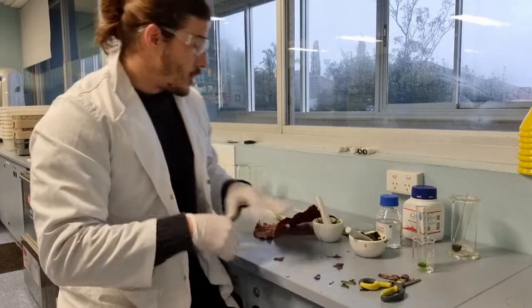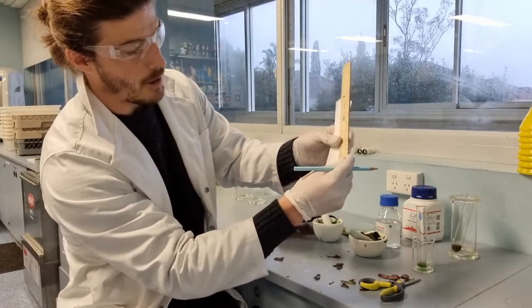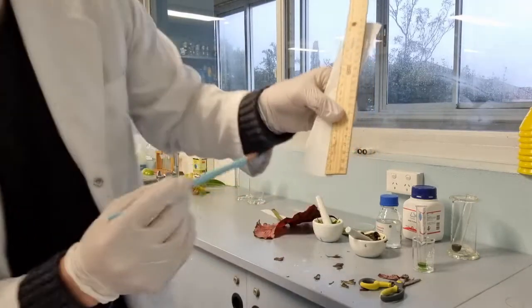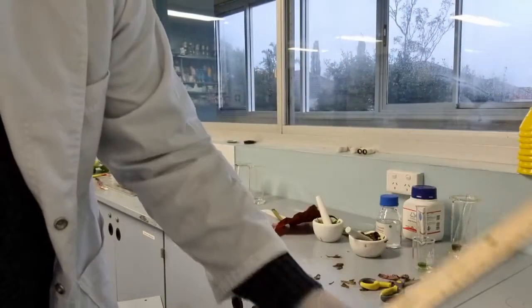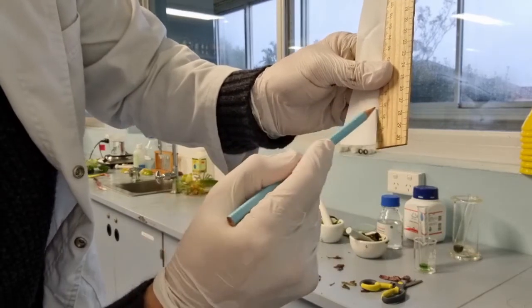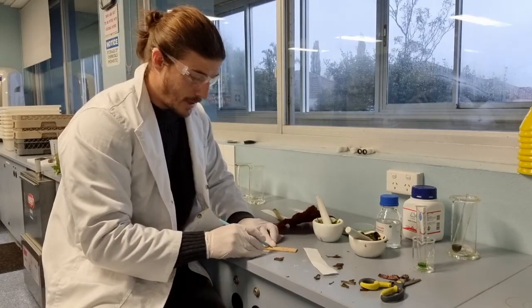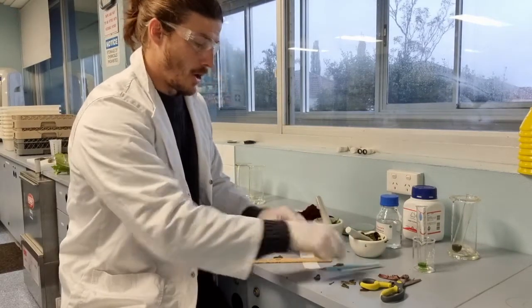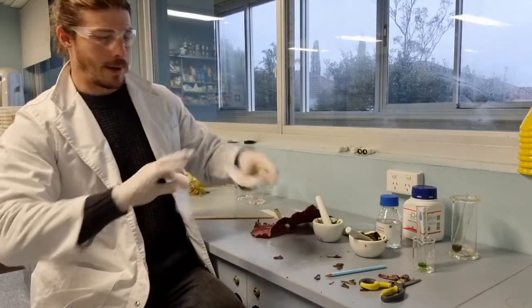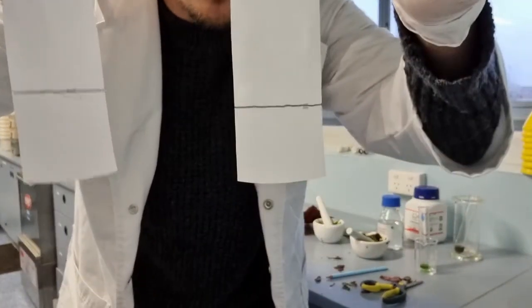Now, in order to do chromatography, put a small line on your bit of paper. I'm going to put them 3 centimeters up. So here you can see my chromatography paper, there's my ruler, and I'm going to mark a little mark there for my red leaf, and then mark one there. Okay, and I'm going to properly draw a line across just so it is really clear to me. Alrighty, so I've got 2 chromatograms, or soon to be chromatograms, and I have 2 lead pencil marks on them at 3 centimeters high.